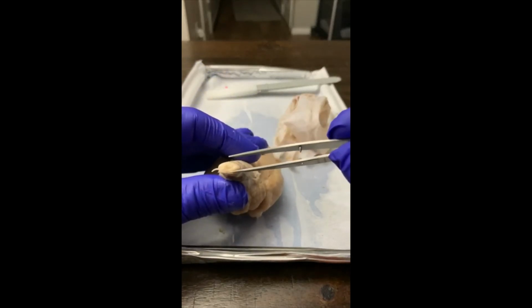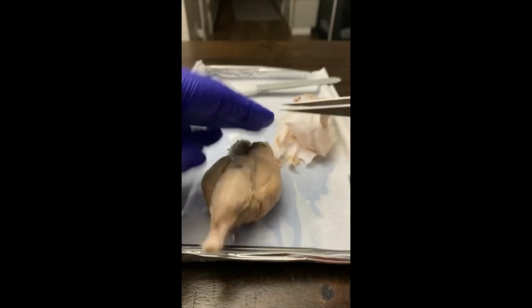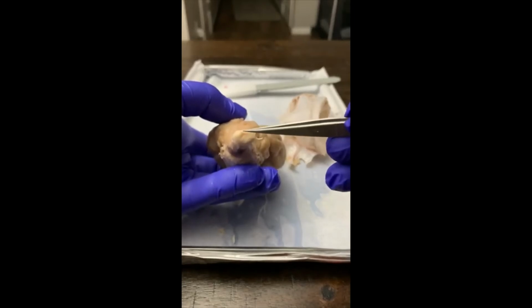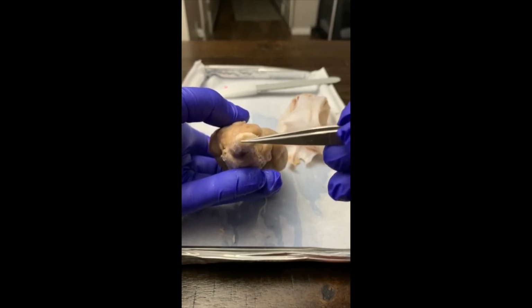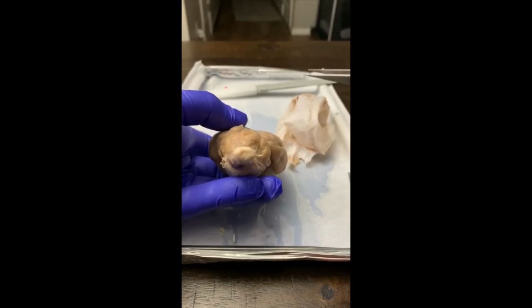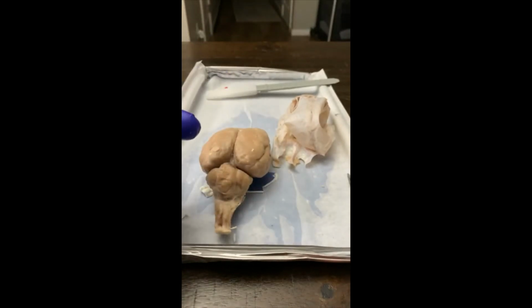So then finally, we'll go to the spinal cord before we cut this open. So your spinal cord here. You have your white matter on the outside, your gray matter on the inside, and then if you flip it over, the dorsal roots are going to be up top, and the ventral roots are going to be on the bottom. You can kind of see that little X-looking horn in the center there. So I'll cut this open and finish the lab.